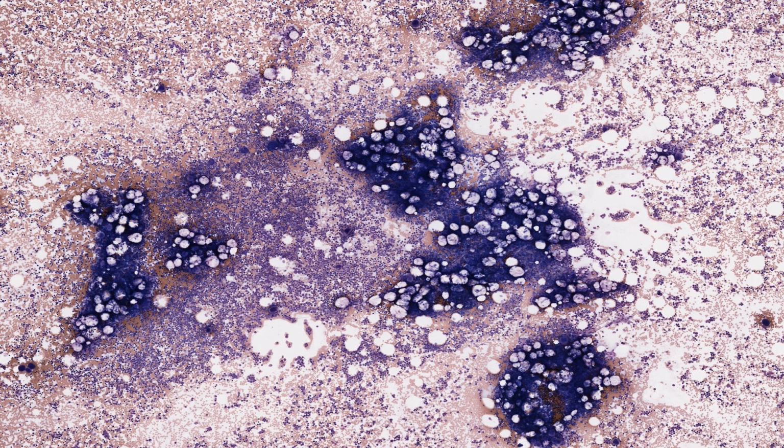Firstly, I'm showing you a bone marrow smear in this image. The slide was prepared by smearing a drop of human marrow tissue across a glass microscope slide. The cells adhering to the surface were dried and stained with Giemsa stain, a special stain for bone marrow. As with hematoxylin and eosin, acidophilic structures stain red and basophilic structures blue.